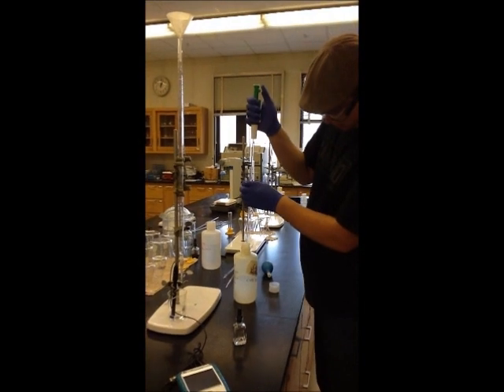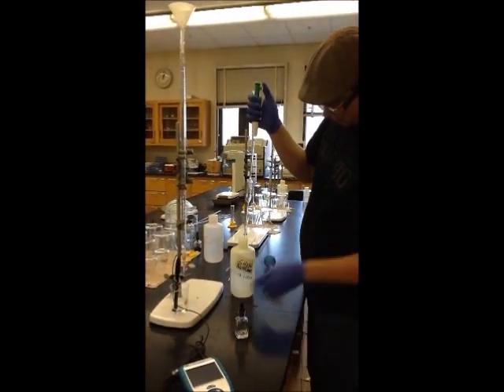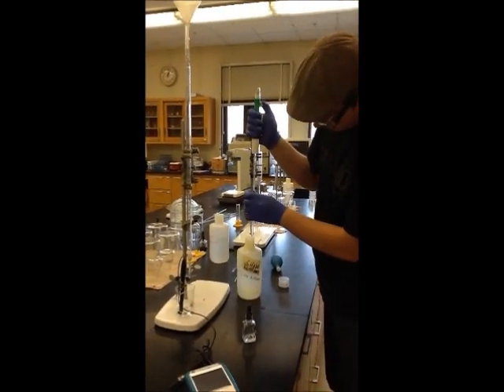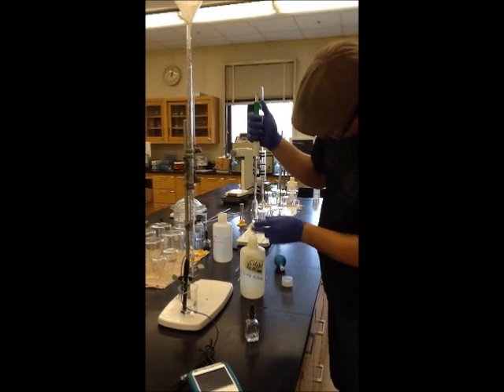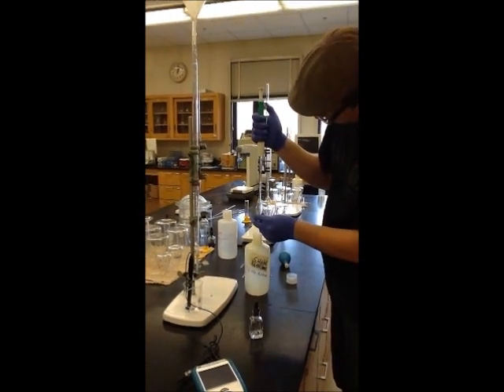We're going to need to now fill the burette with our titrant, sodium hydroxide, which is approximately 0.1 molar solution as well.